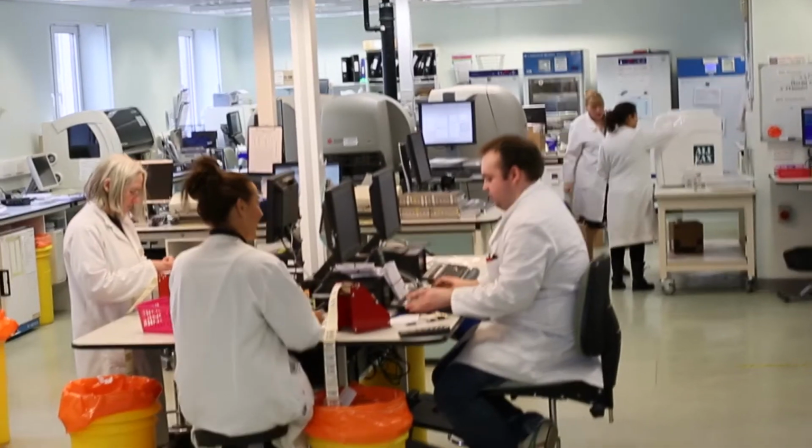I know we're one of the few trusts around the country that do currently use the iPads, which I can't tell you how much it's changed the way that we work within the laboratories, especially to complete the auditing. As I say, it's much more efficient, much quicker, and it's certainly helped with our CPA and ISO 15189 accreditations, maintaining our audit schedule and being able to action things much faster. It helps with this ethos of continual improvement that ISO 15189 are looking for. So yeah, if there's one reason to go with Q-Pulse and iPads, definitely the audit app would be my thing to go with.